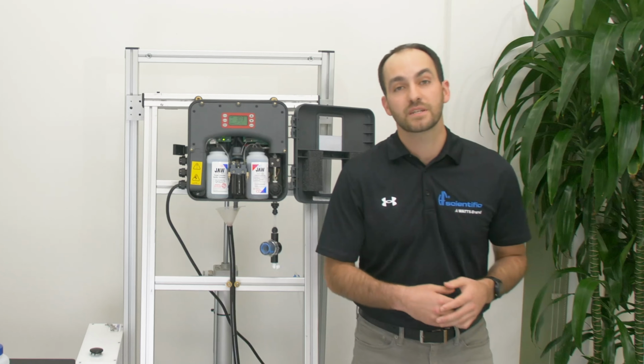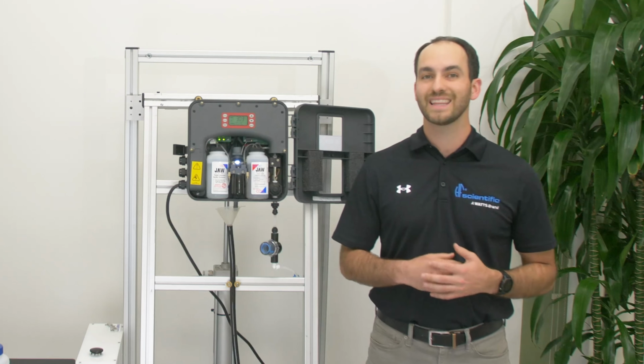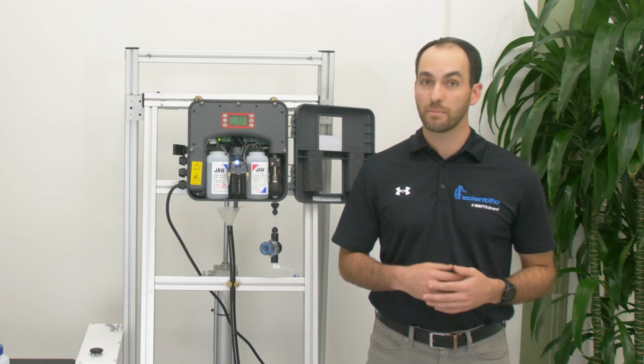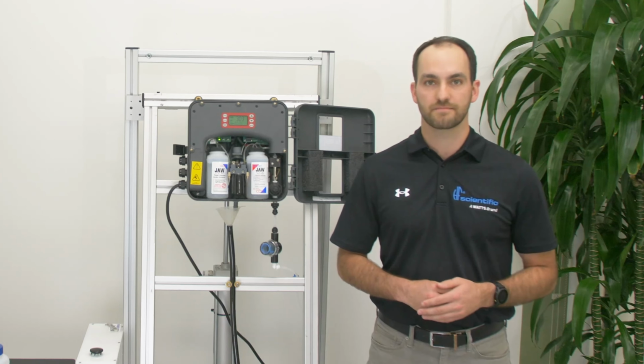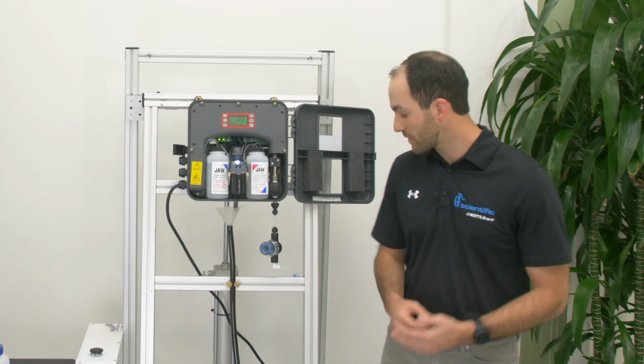This might be a good time to clean out the T-strainer and hook up a pressure gauge to ensure that you have at least 5 psi on the line. If you are replacing a competitive analyzer, you may have a standpipe which will cause the pressure to be below the specs of the CLX.